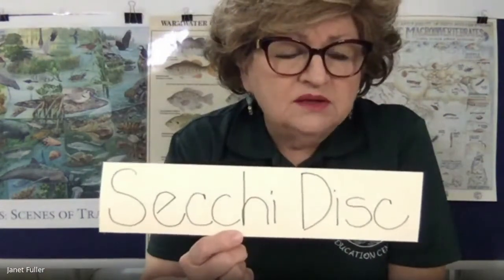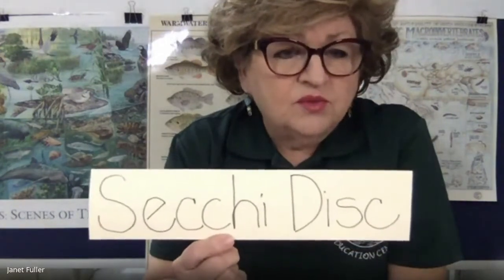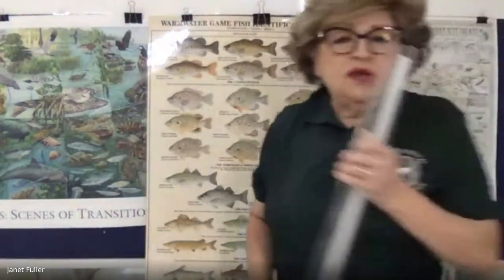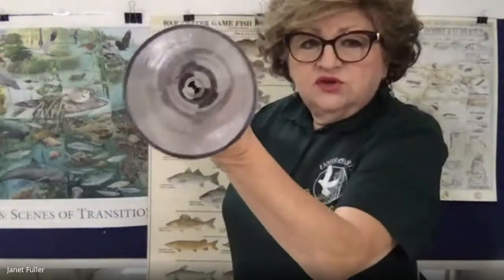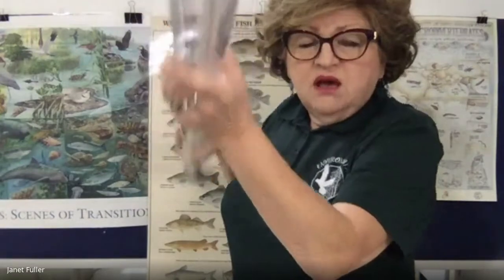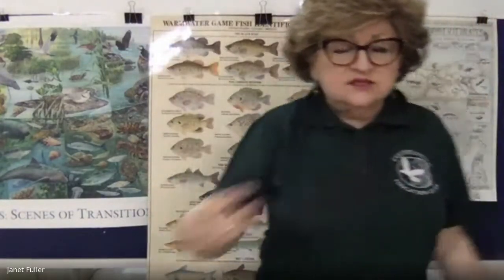I talked to you in the video a little bit about the Secchi disc. I wanted you to see how it was spelled. It's an Italian name. He actually was an astronomer, but he's the guy who invented it. I'm going to show you. You weren't able to see it in the video, but this is the turbidity tube. You can see the Secchi disc way down in there. Can you see that? Okay, that Secchi disc is what Mr. Monroe was looking for as the water drained out of the turbidity tube.